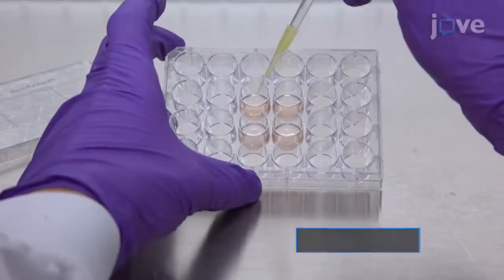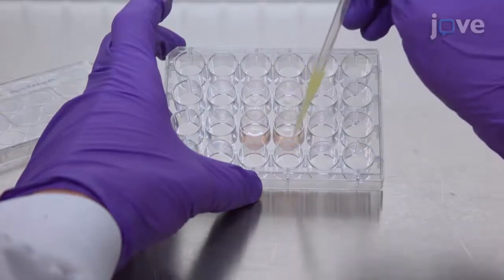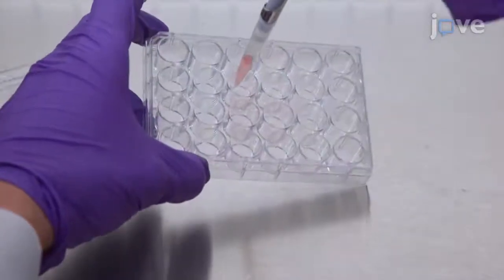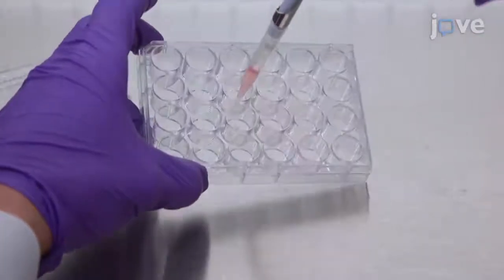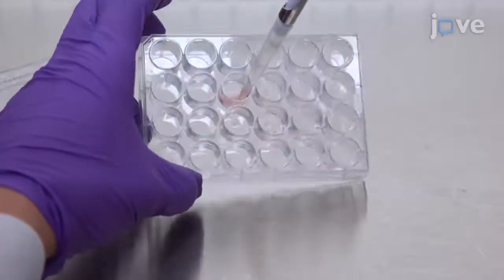After preparing the organoids, carefully aspirate the culture medium without disturbing the droplets of basement membrane matrix. Add 500 microliters of cold basal medium to the first well of organoids. Using a P1000 pipette, gently pipette up and down to disrupt the basement membrane matrix droplets with organoids.